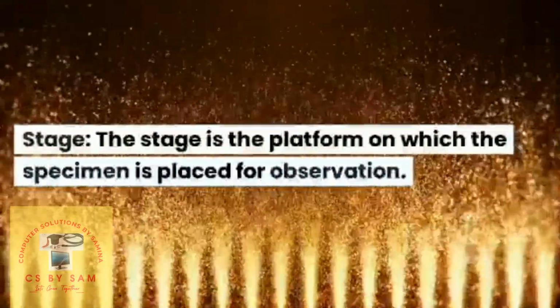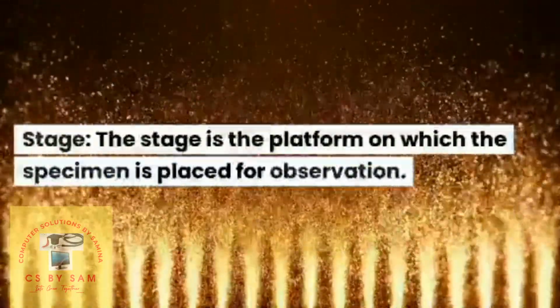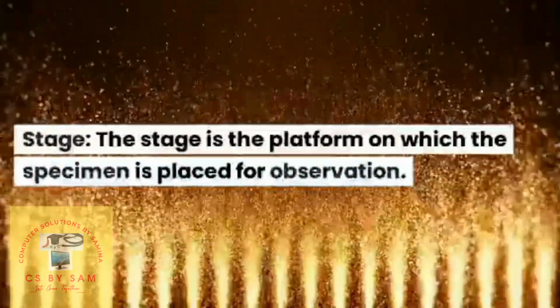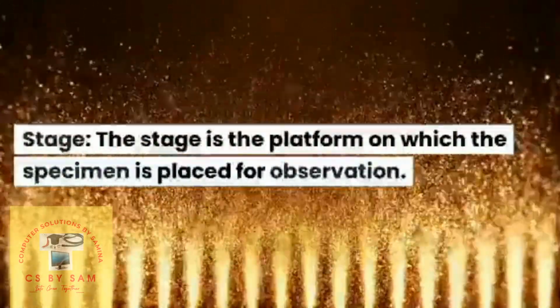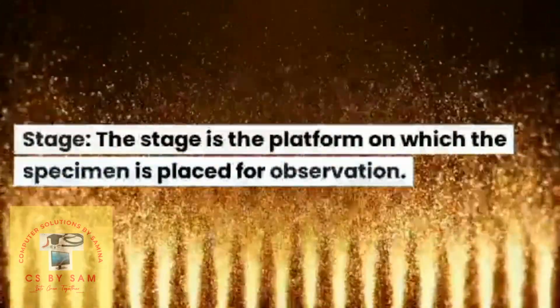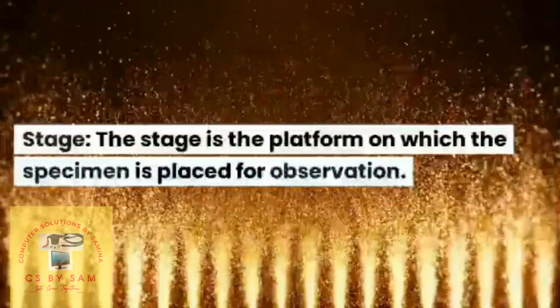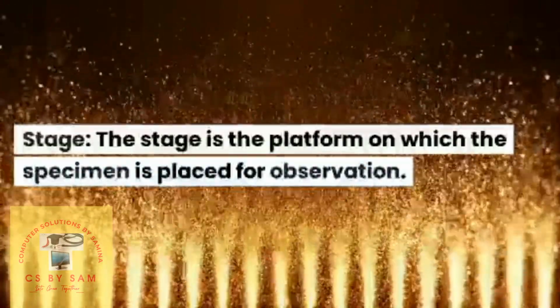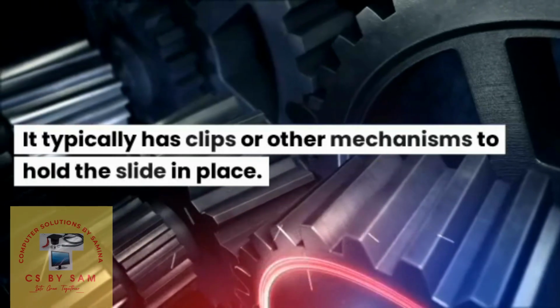The stage is the platform on which the specimen is placed for observation. Most of the time, specimens are stuck or present in the form of a smear on a glass slide, and this glass slide with the smear is placed on the stage.